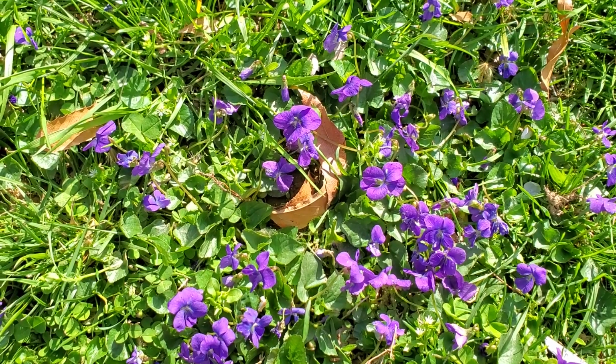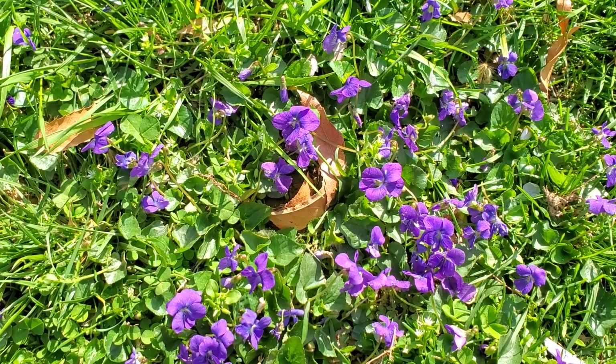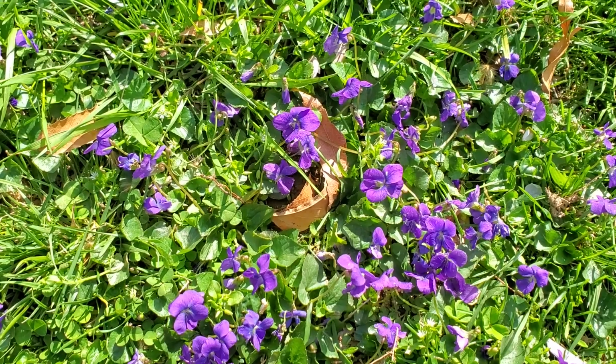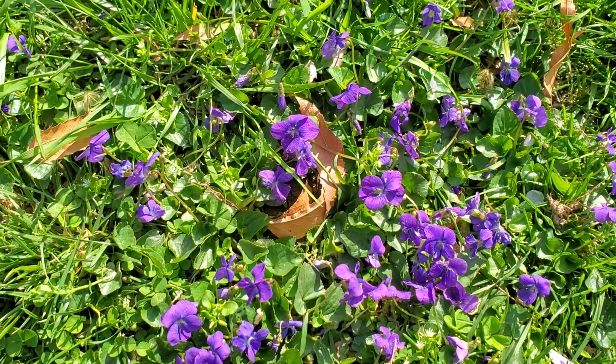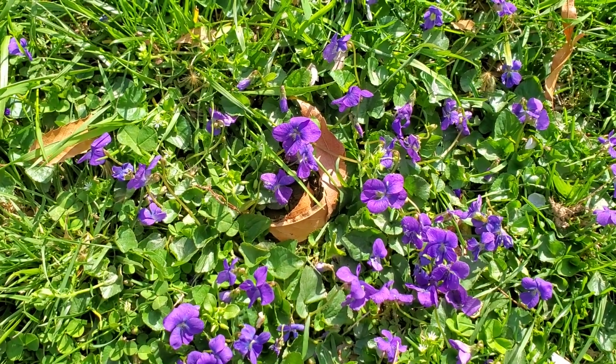The other day I collected pollen from my car. Today I'd like to try collecting pollen from a flower, so we can put that under the microscope and see whether it looks different from the pollen I gathered the other day.